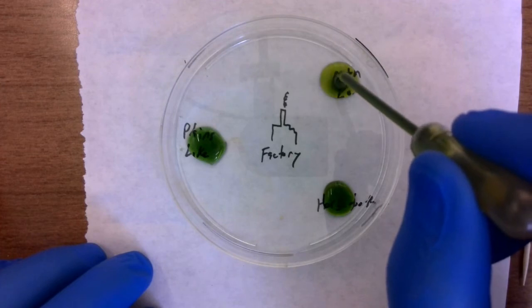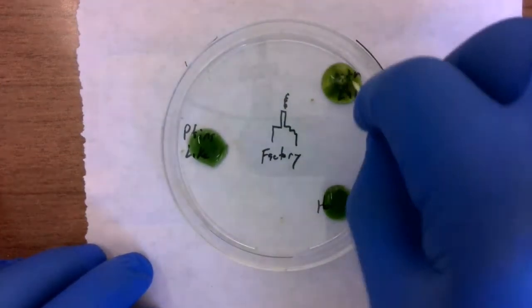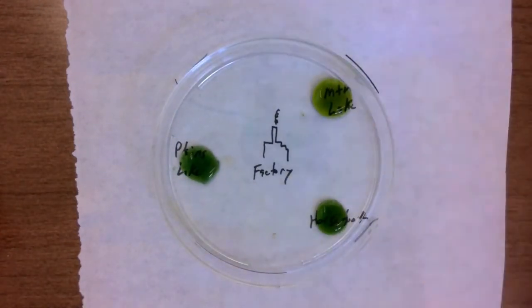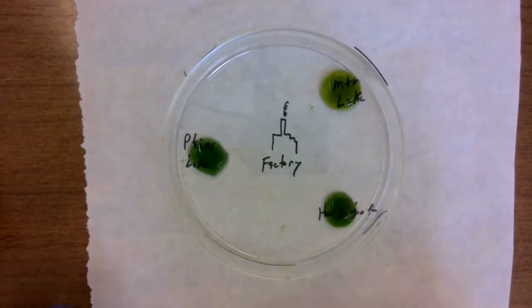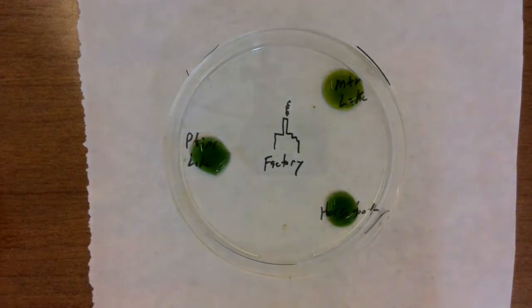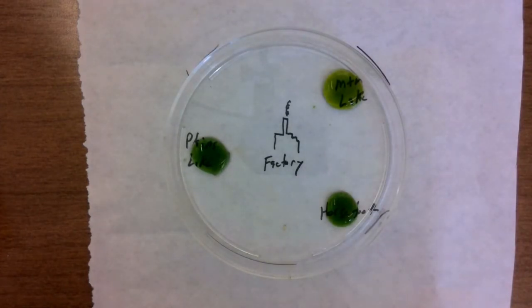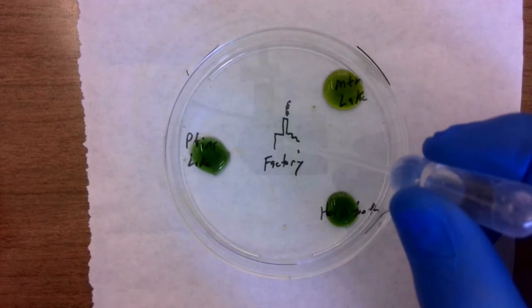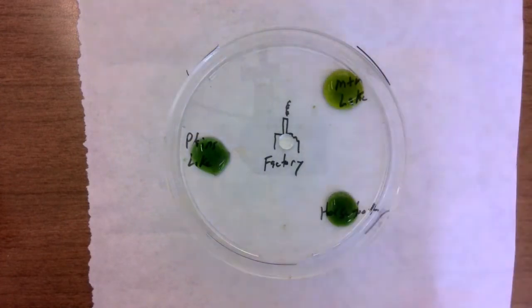The color's different. Okay. Now I'm going to go ahead and add the chemicals that are going to simulate our factory or car exhaust, those chemicals that are going to create acidic rain. For that, I'm going to use a little bit of sulfuric acid. That should ring a bell because we've talked about sulfur dioxide converting to sulfuric acid. So I'm going to put a couple of drops of that in our factory.